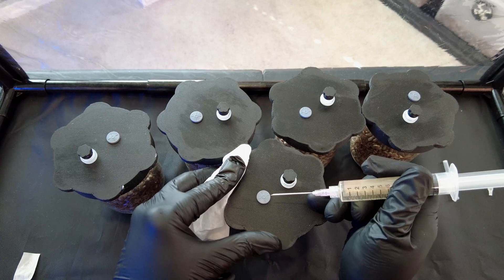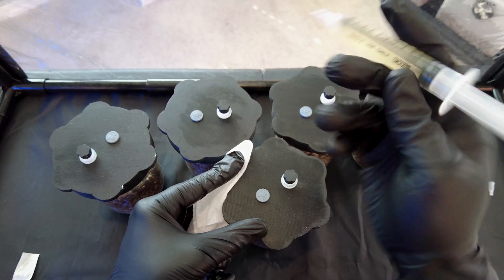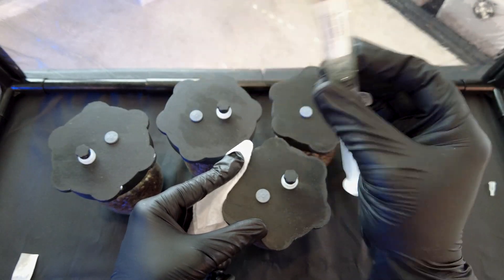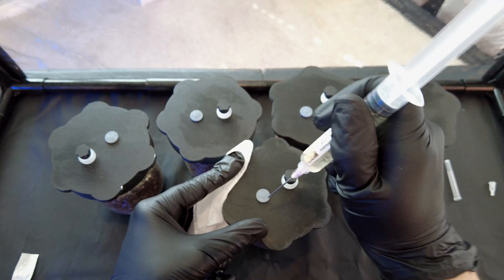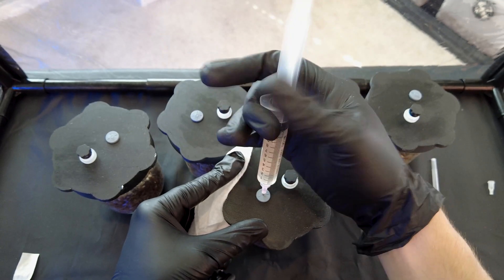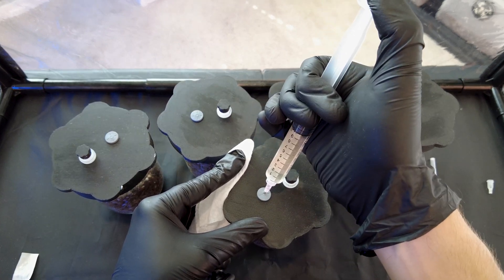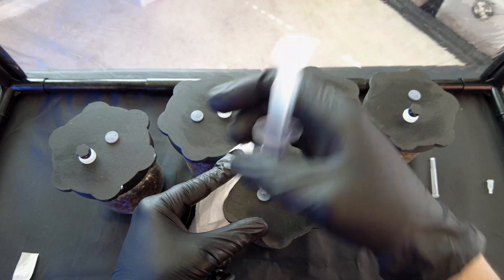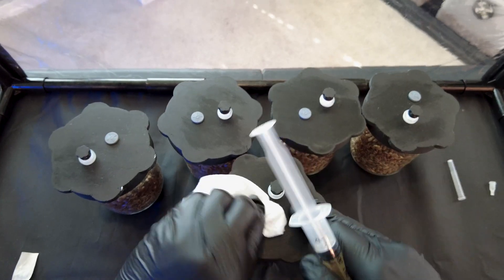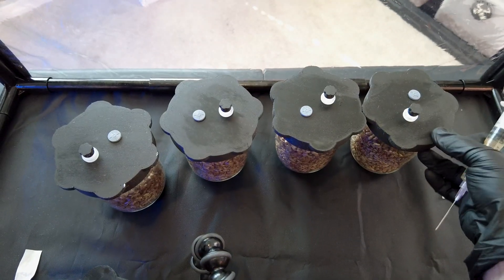This is what it's all come down to — putting the mushrooms in their grain jar, squirting that mycelium from the liquid culture down into the jar. Let's give the syringe a good shake to distribute all the liquid culture. Now let's inoculate: I'm going to go right into the center of the inoculation point, press onto it, drive the needle down in, and take it down to about nine cc's — injecting about one cc. Then we pull this out and immediately sanitize the hole. Let's set that jar aside and bring in another one.